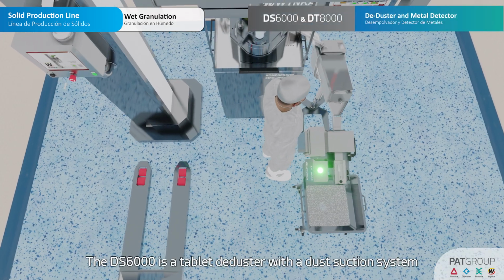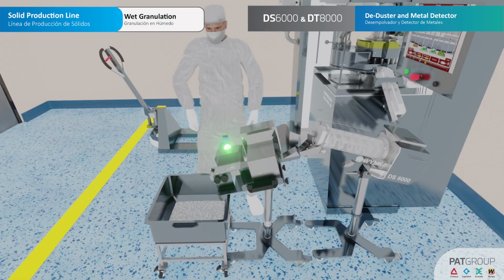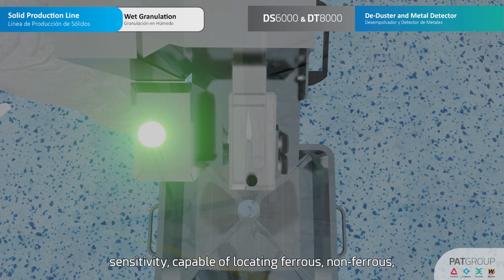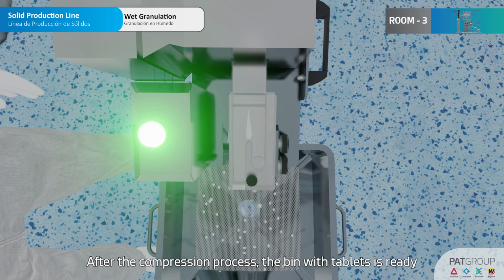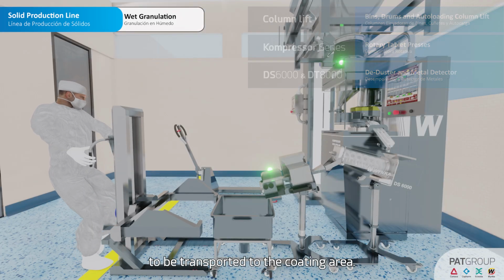The DS6000 is a tablet deduster with a dust suction system and a helical feed screw. The DT8000 is a metal detector and separator with maximum sensitivity, capable of locating ferrous, non-ferrous, and stainless steel metals. After the compression process, the bin with tablets is ready to be transported to the coating area.